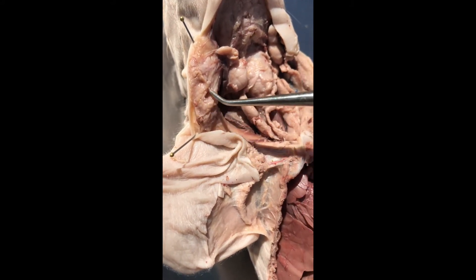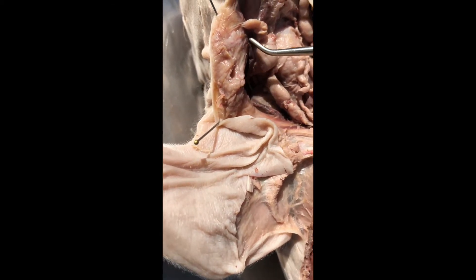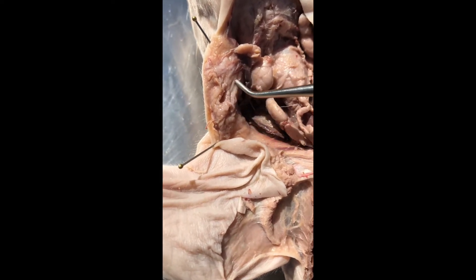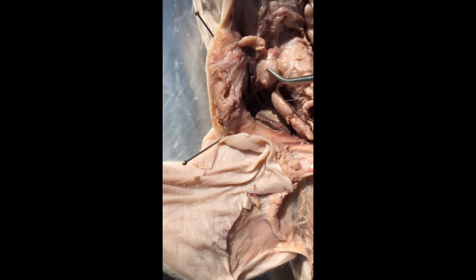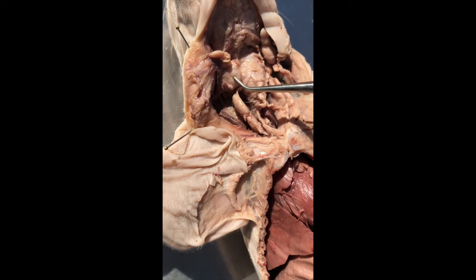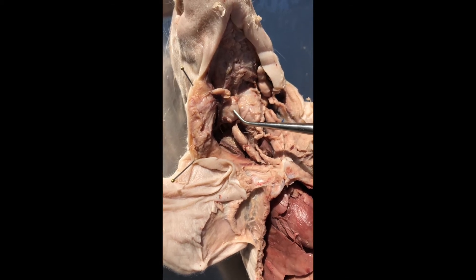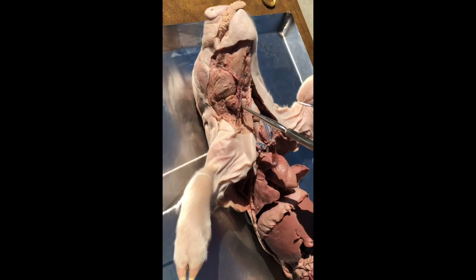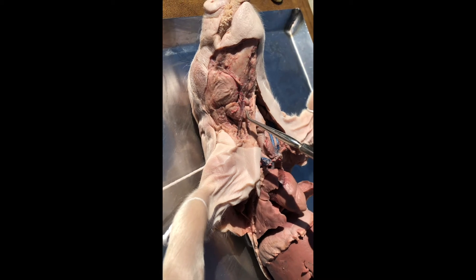We have these little stick-me-outs here — that's probably a duct. And you can see all of these — if I kind of push on that a little bit — you see all these radiating strings; some of those are going to be nerves, some of them ducts, some of them blood vessels. This is that same facial vein you saw over there, and this is then that submandibular gland. Sweeping back to the other pig — this gland is this gland, right where I have the probe.